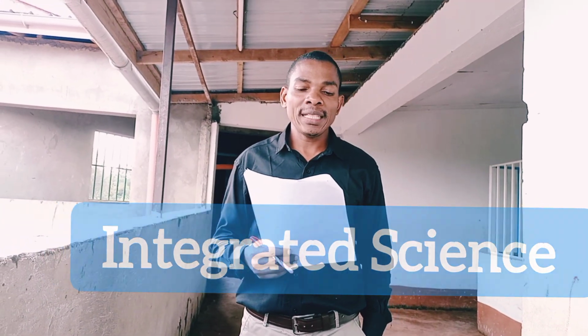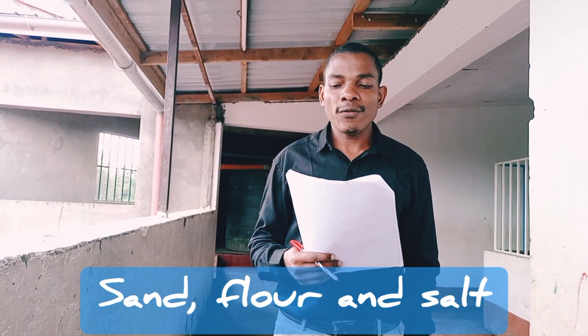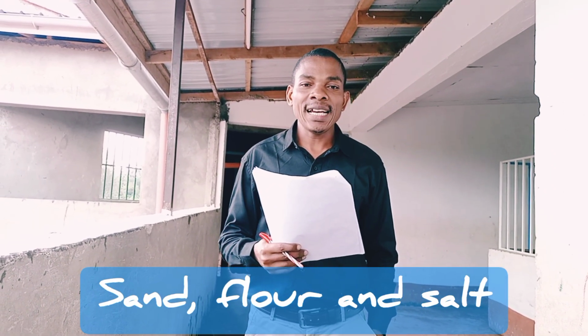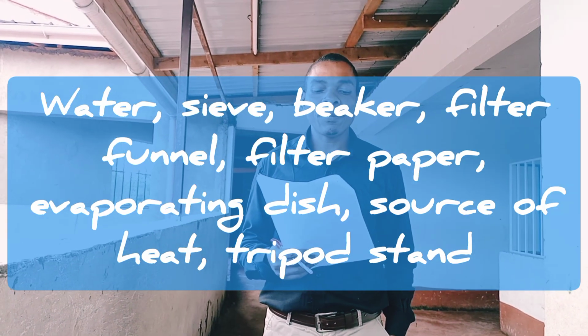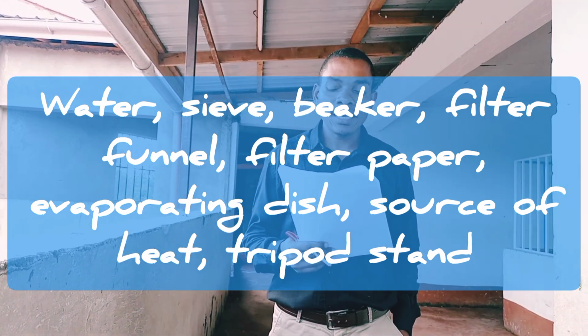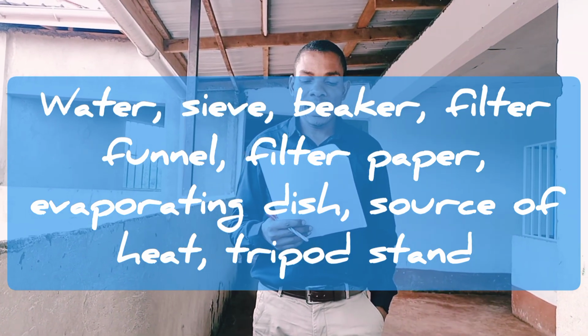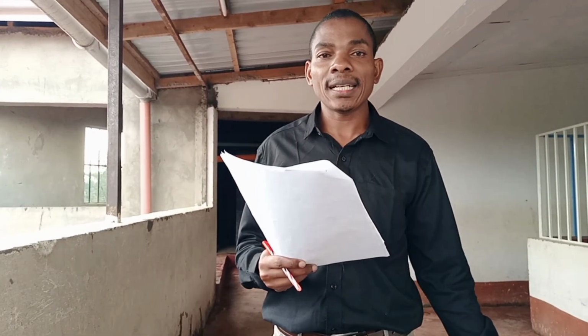So for this assessment, you are provided with the following: a mixture of sand, maize flour, and salt, water, sieve, beaker, filter funnel, filter paper, evaporating dish, source of heat like Bunsen burner, spirit lamp, tripod stand, and a wire gauze. You are required to separate a mixture of sand, maize flour, and salt using simple laboratory technique as taught in the class. Observe the mixture and record its appearance.